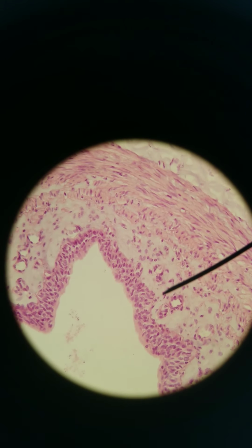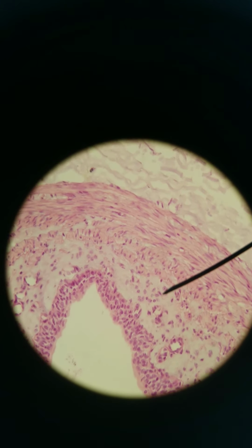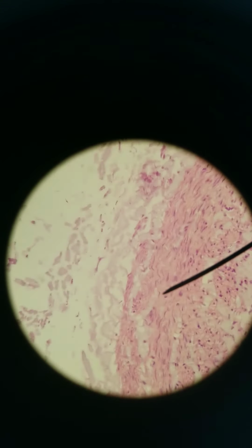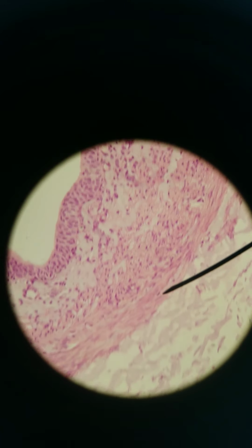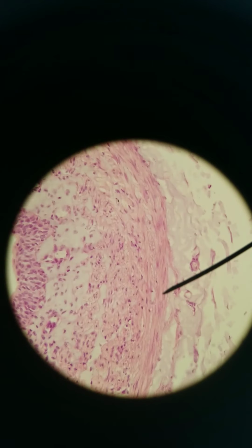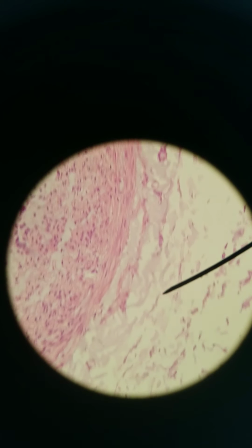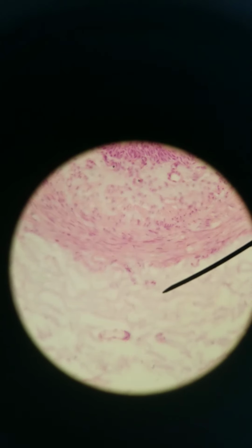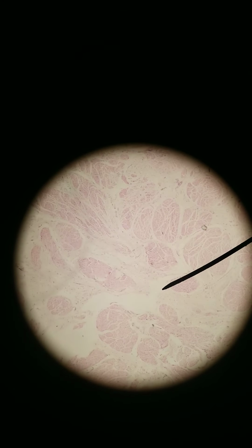You get areolar lamina propria deep to that. And then here's that smooth muscle because we want peristalsis to push urine down to the urinary bladder. And then outside of that, you got your dense irregular adventitia. That is the ureter. So we drain urine from the renal pelvis to the ureter down to the urinary bladder.